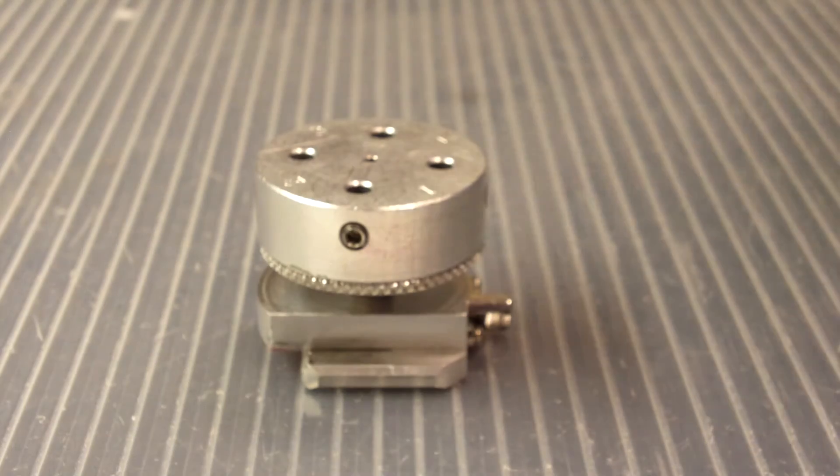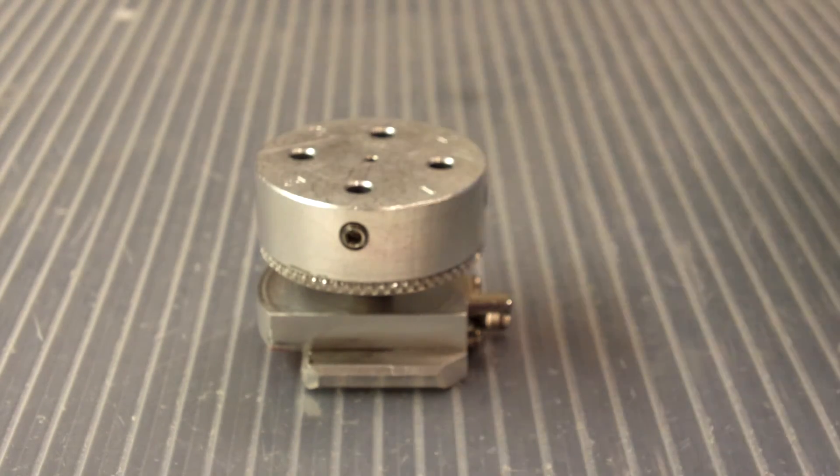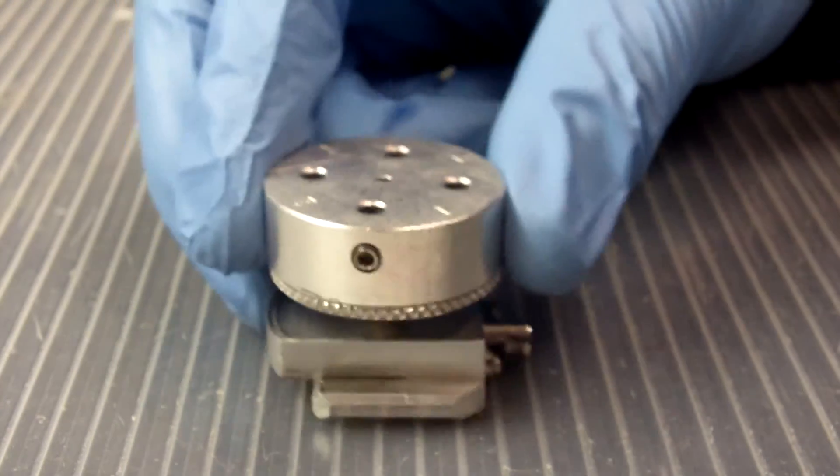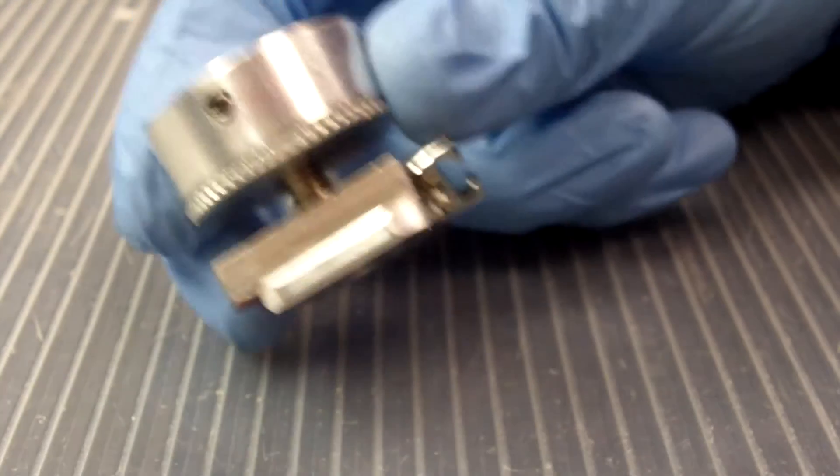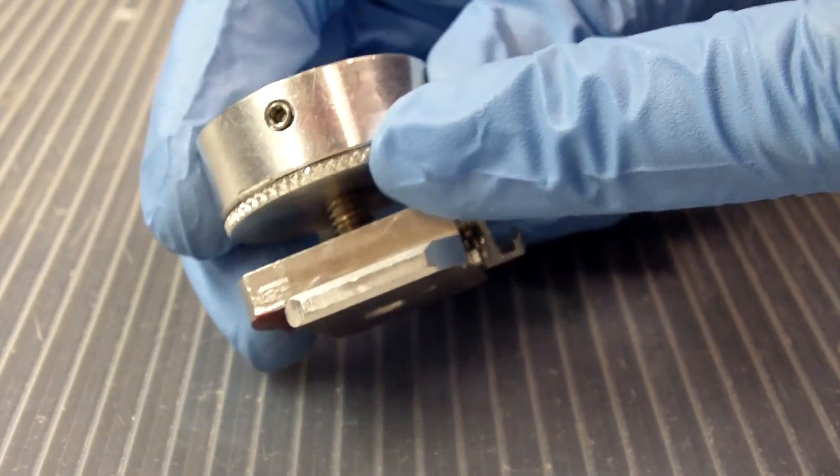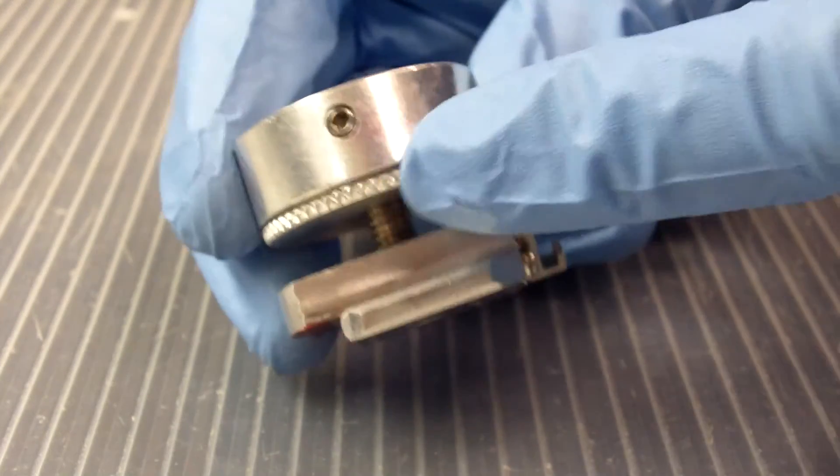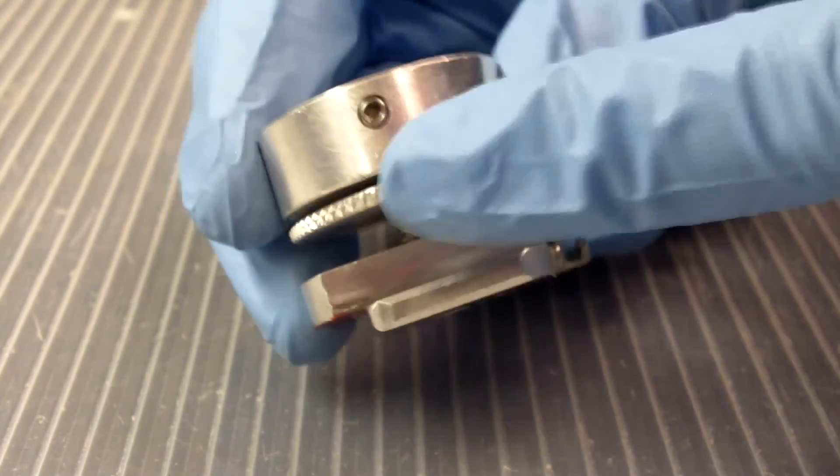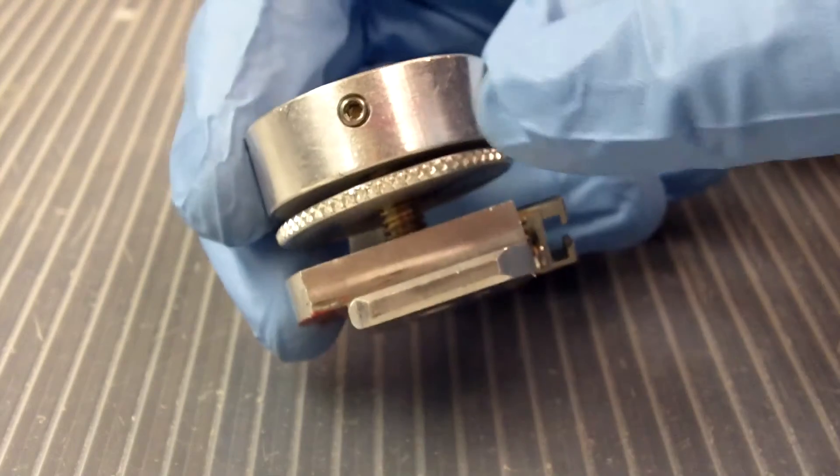Okay. I didn't stage this at all. I honestly went, while I was filming this, into the other microscope room to look at the other sample holder. And we can see that it is put together completely wrong. First off, we have the locking ring up here where the platform is. And what does it do up there, you ask? And I can tell you absolutely nothing.